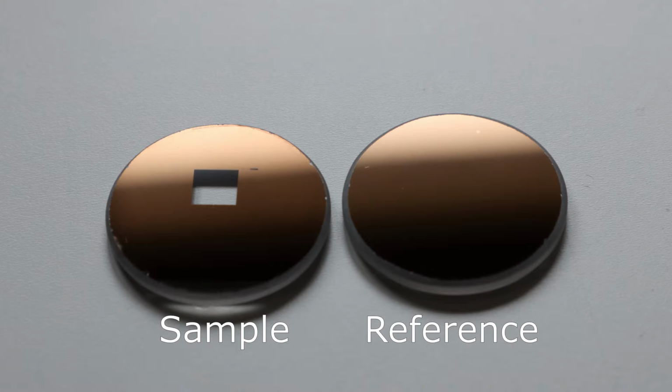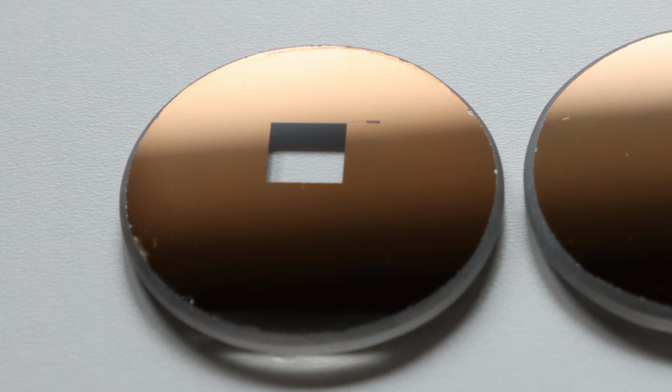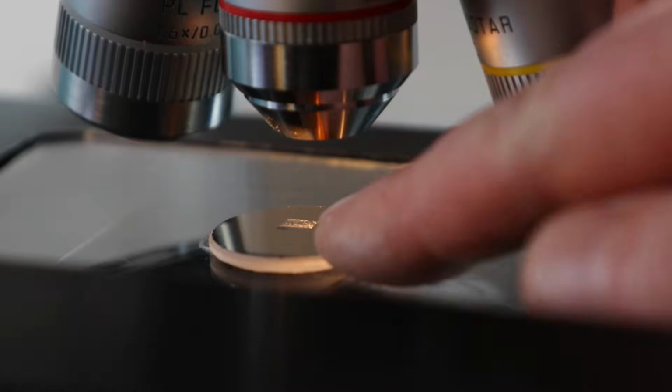Let's take a look at some of the other parts of the setup. Here is an image of the sample that we're going to test together with the reference surface. They're both glass discs that have a very thin layer of chromium on top. And if we look at the sample, we see that there is a pattern etched in the chromium layer, whereas the reference mirror surface has a uniform coating. The main feature in the sample surface is this square area of about 5 by 5 mm where the chromium was removed. And if we quickly view this pattern in a bit more detail under an optical microscope, we see that there is a line of chromium in the center of the etched area. Also, near the top right corner, there is a pattern containing some very small test features.